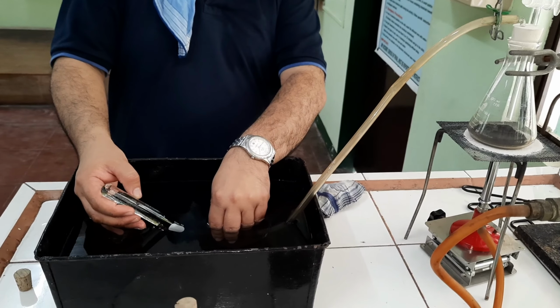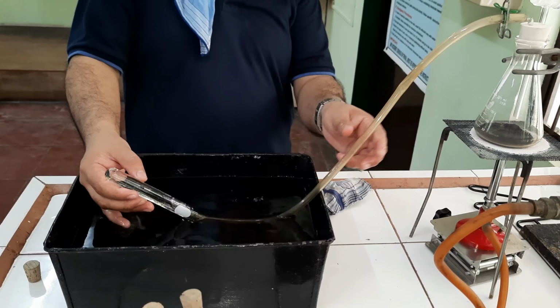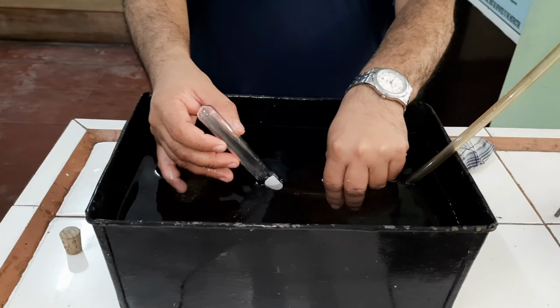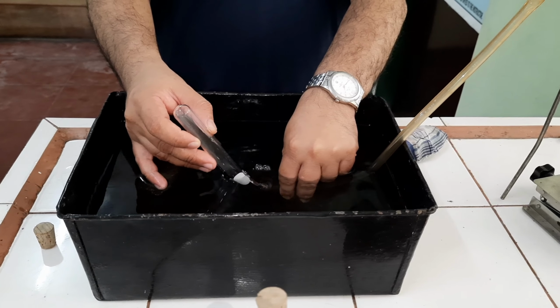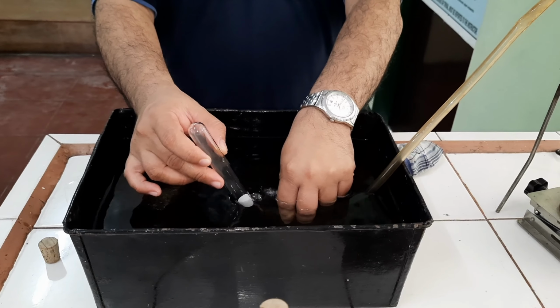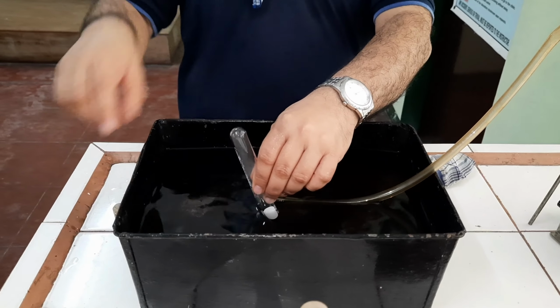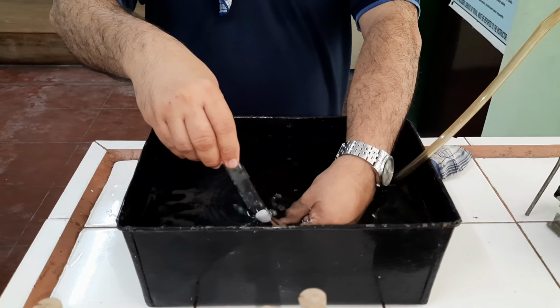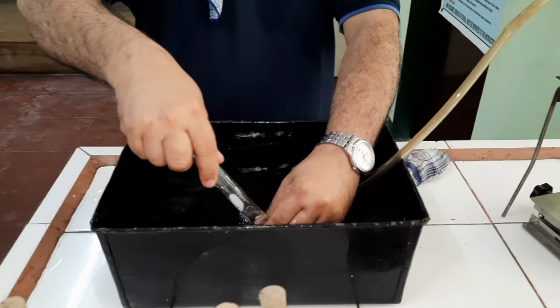There is not yet enough oxygen generated. Let us wait for a little while. There we go. Focus it here. You could notice the water has been displaced, meaning there is now oxygen getting into the tube. As that continues, I will now insert this underwater so that I can prevent gas from leaking out of this tube.